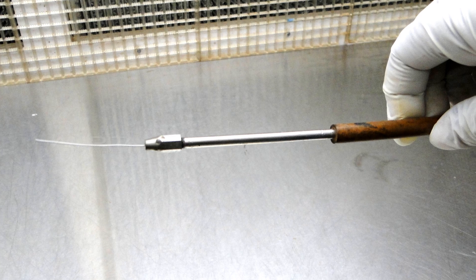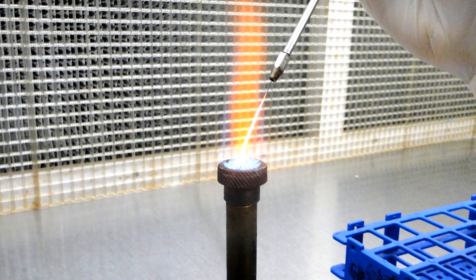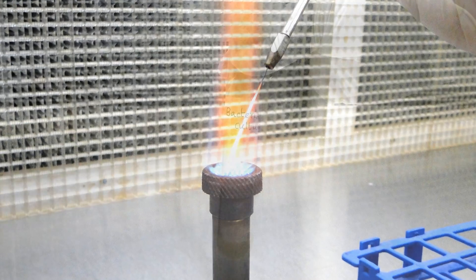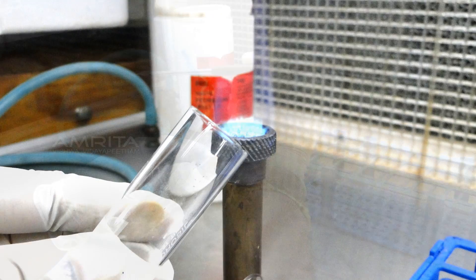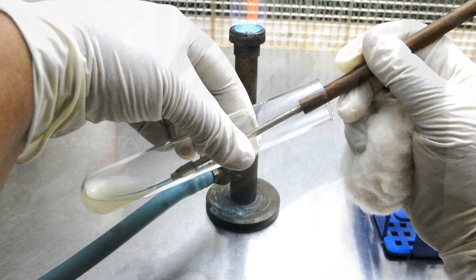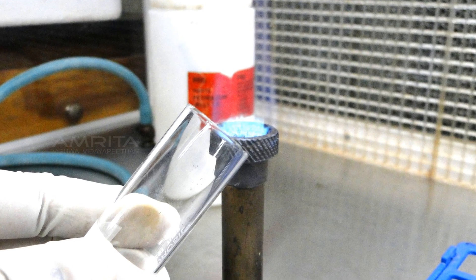Take the inoculation needle, flame it till red hot and allow it to cool. Now take the bacterial culture and remove the cotton plug. Flame the mouth of the tube, insert the inoculating needle into the culture tube, then flame the mouth of the bacterial culture again, close it, and keep it back on the rack.